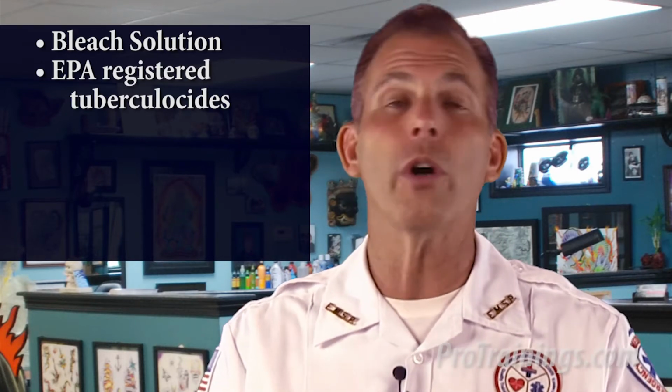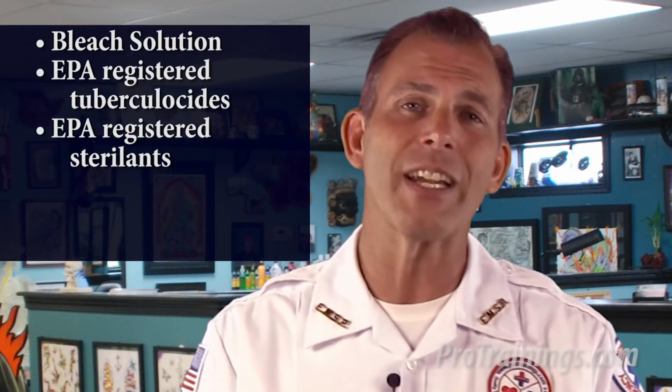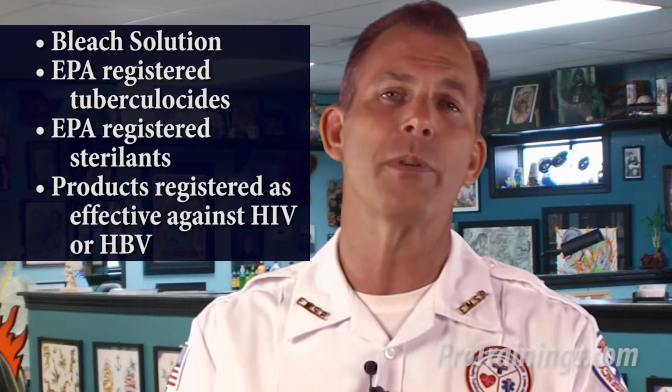Cleaning of contaminated work surfaces after completion of procedures is required to ensure that employees are not unwittingly exposed to blood or other potentially infectious material that may still remain on a surface from a previous procedure. Appropriate disinfectants include a diluted bleach solution, Environmental Protection Agency or EPA registered tuberculicides, EPA registered sterilants, or products registered as effective against HIV or HBV.